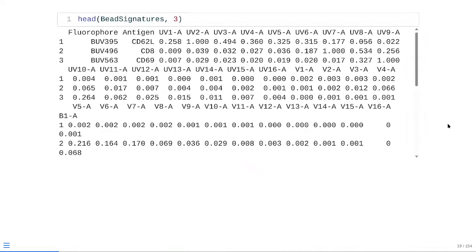And sure enough, if we check the actual view of our underlying data, we can see they're still correctly ordered. We've got BUV395, 496, 563, following that laser and peak emission wavelength pattern, as we saw. And then if we look at the actual values, we can see they have already been normalized or scaled, with everything being between a value of 0 and 1.